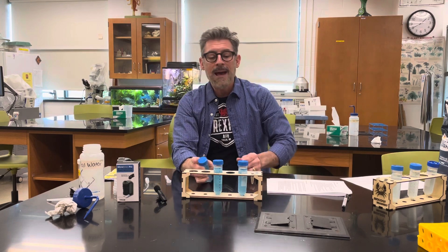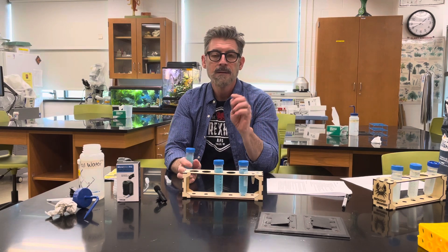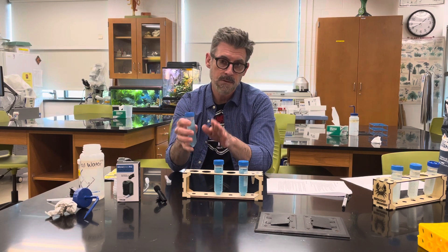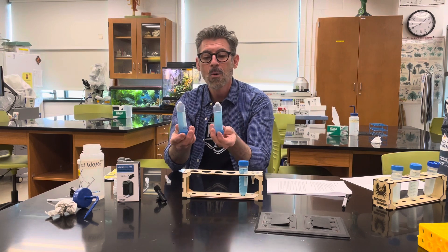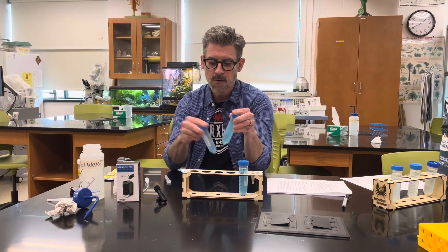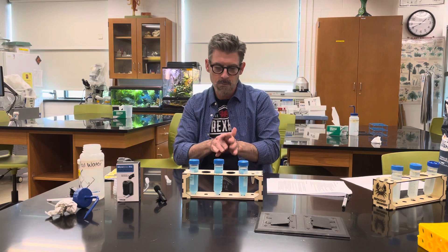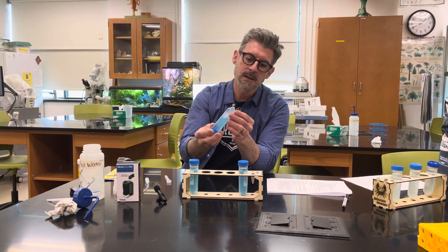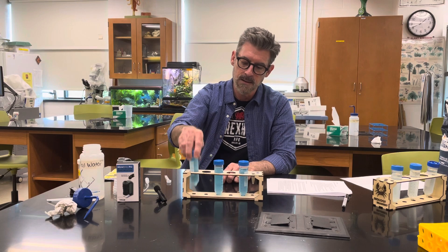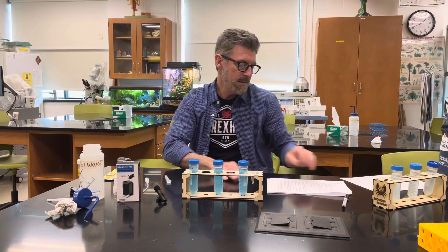The order of adding things: yeast must be added first to the tube, then you do the dilutions, then add methylene blue dye to all three, and then add sugar to two of them. If you add the dye last after the sugar it won't make a difference. The key thing is to make sure the sugar is fully dissolved — there should be nothing sitting on the bottom. If there is, keep inverting the tube until all the granules are gone, otherwise the bottom will be super concentrated and it will affect your results.